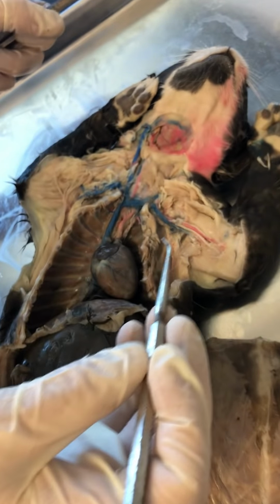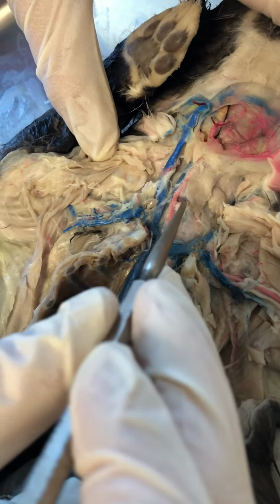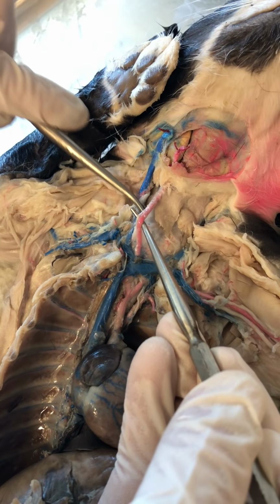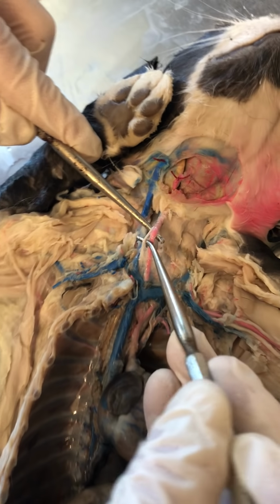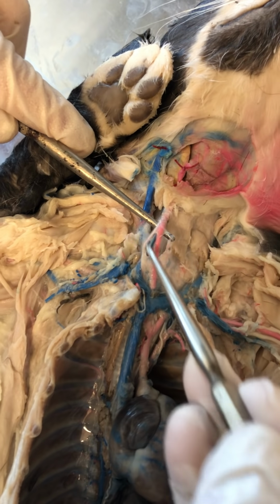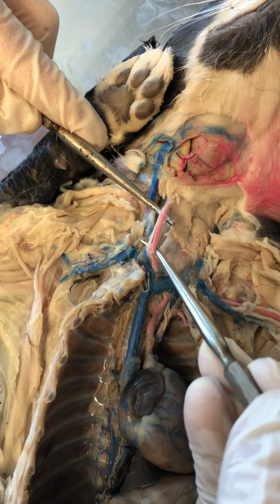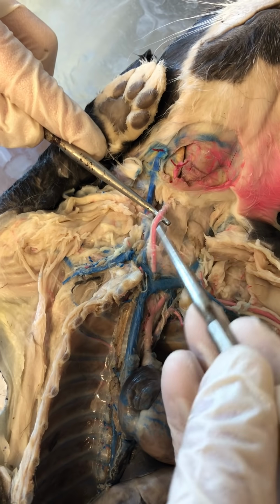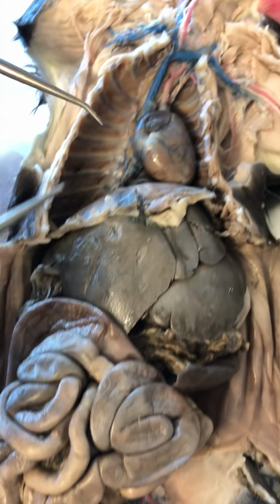There are 2 nerves. We need to find 2. Okay, so the first one is going to be our vagus nerve. So when I find my carotid artery, okay, you can see this white string-like structure running directly parallel to that carotid. That is going to be my vagus nerve. Okay, so both carotids have a vagus nerve running alongside of it. Nice. The other nerve is going to be my phrenic nerve.